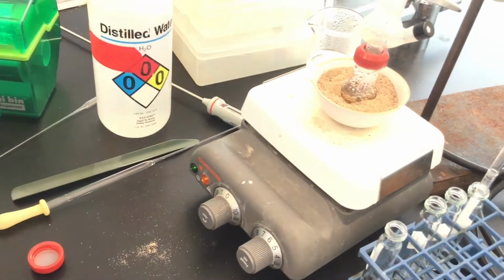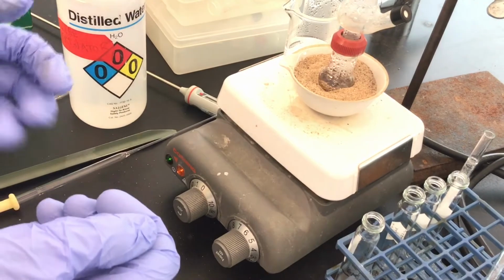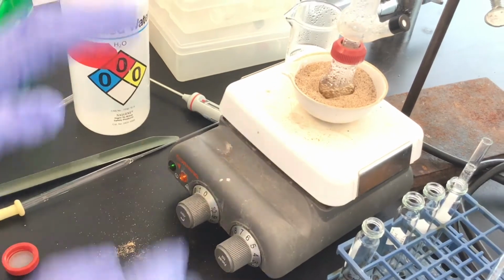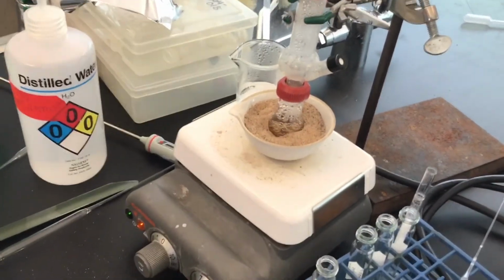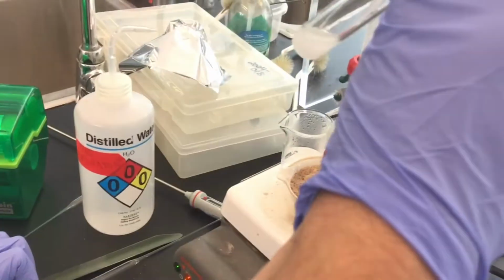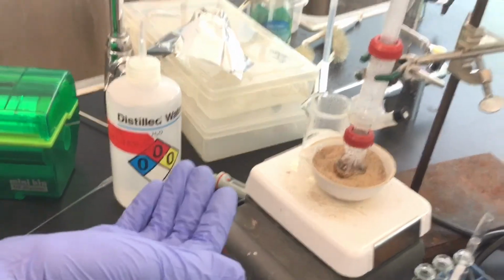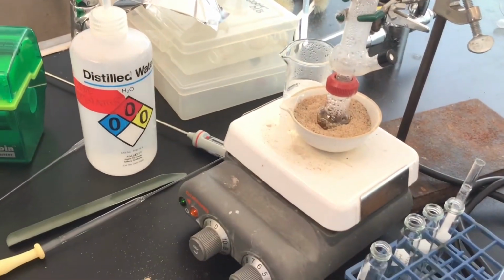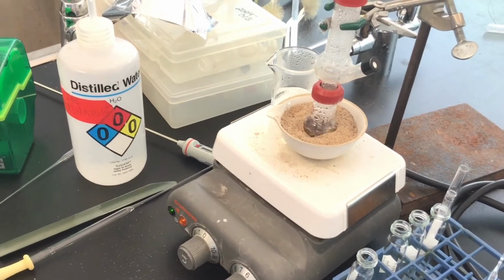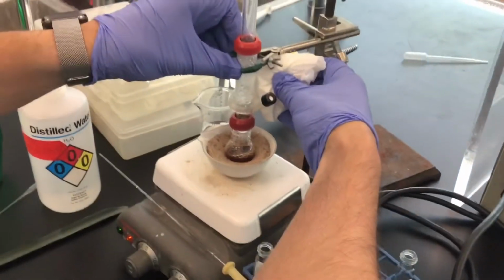So in that sense, when you're doing it on a large scale, if you're a natural products chemist and you're focusing on isolation, you don't have to worry about continuing to add water. You can just sort of set it and forget it and come back. But here we've got to monitor what we're doing. When you're doing it on that large of a scale, obviously you can still have some milky distillate, but it's so large that, once again, you have two phases. You'll see two layers. And we'll talk more about that when we perform the extraction process part of this experiment. Good. All right, so every time you do an experiment, you learn something new.